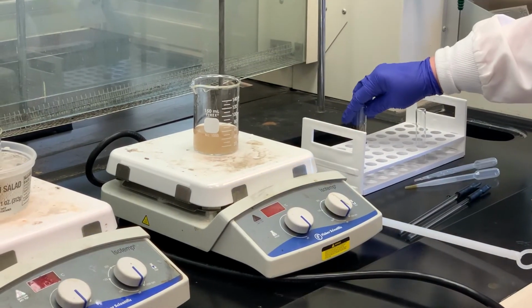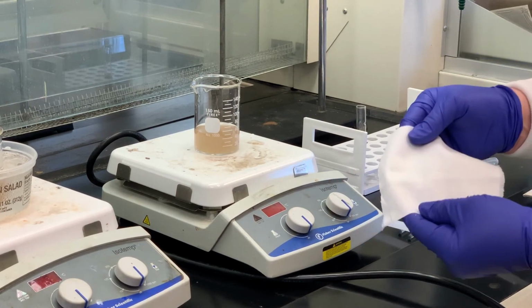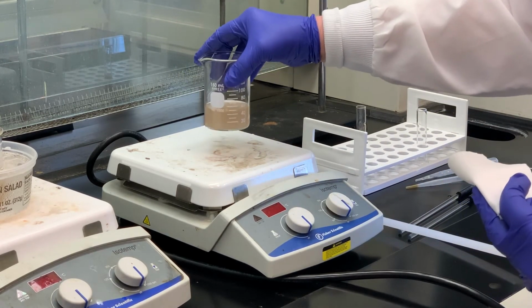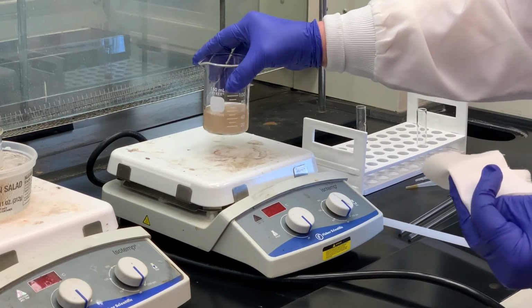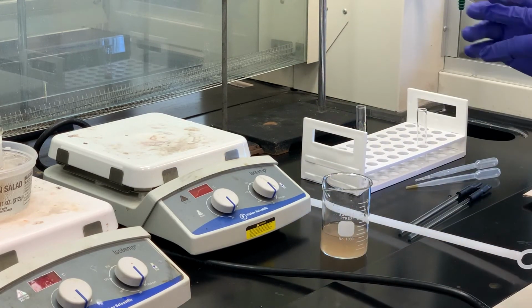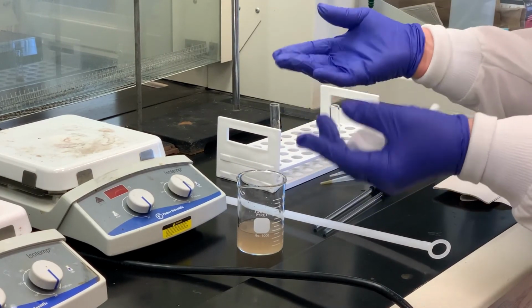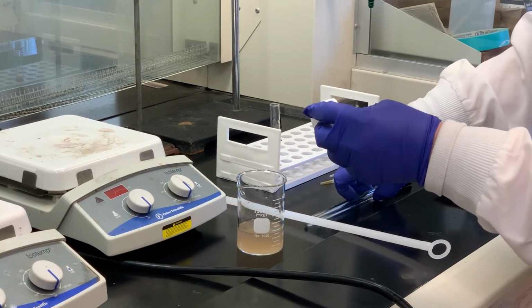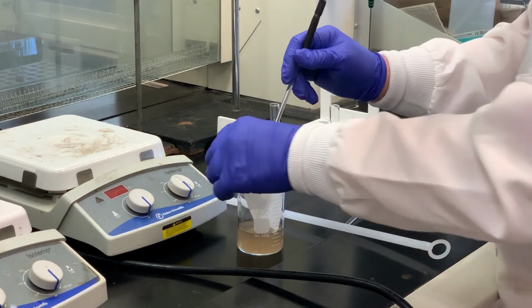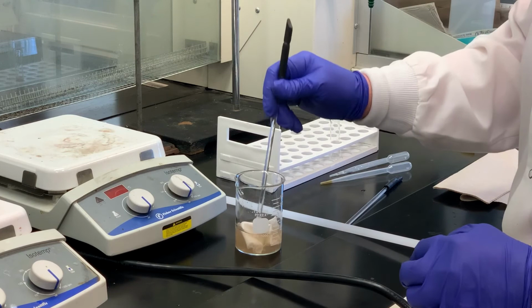What I also want to show you is how you can take a swatch of fabric, this is just a piece of cotton, and what I'm going to do is immerse this in the sodium hydroxide solution of the beta-naphthol. And again, no matter what experiment you're doing, you always wear gloves, especially today when we're using a fairly concentrated solution of sodium hydroxide. I'm just going to take a stirring rod and put this piece of cotton inside there. Kind of move it around, let it get saturated.